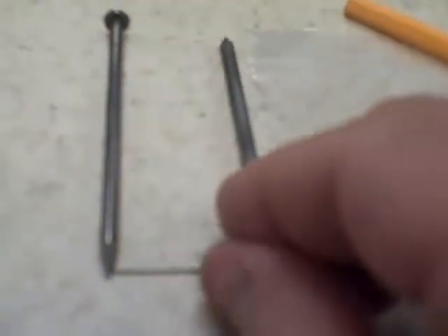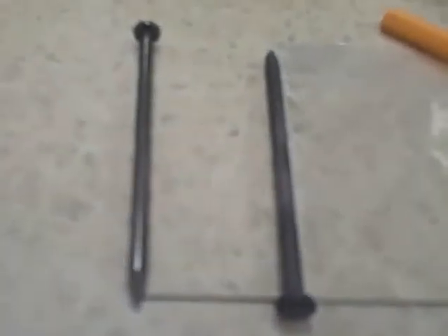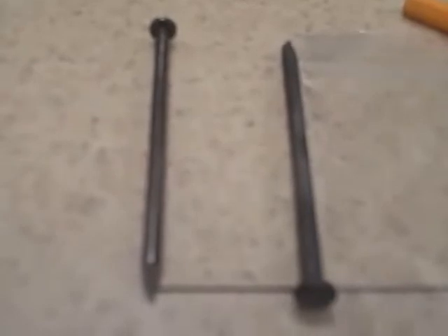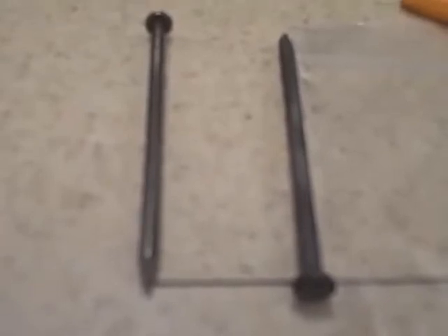Okay? Don't get it on your hands. Wear those gloves. When you're done and you've got as much of the zinc oxide off as you can get, then take the little piece of sandpaper that's there and roughen up the surface of those nails to try to get any excess zinc off of the nails.